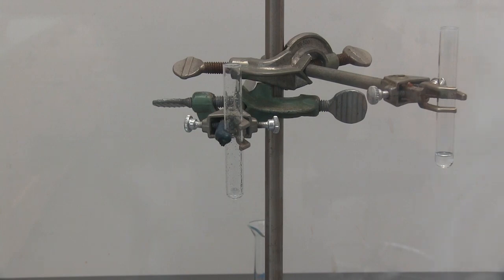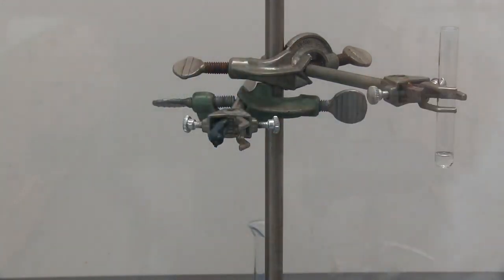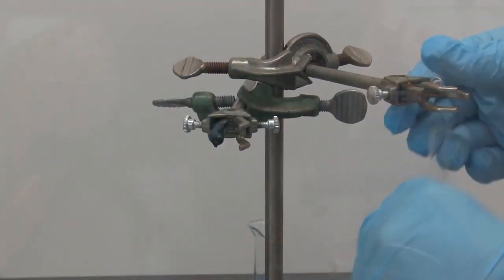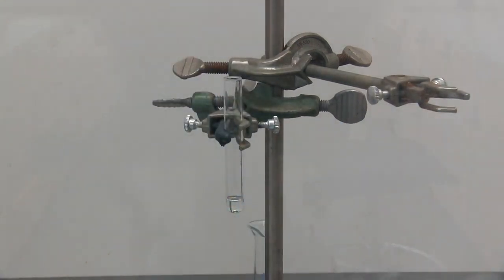I don't think I can get any more, so I'm going to move this back to the side. And this is our product. Now we're going to test it with a bromine test and a potassium permanganate test.